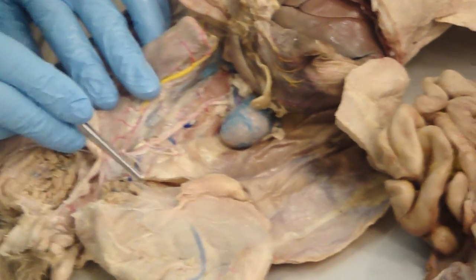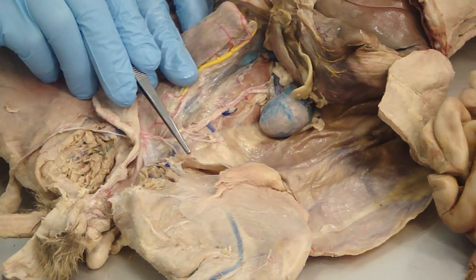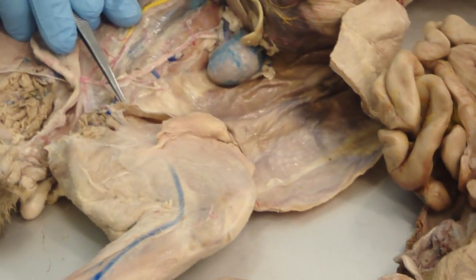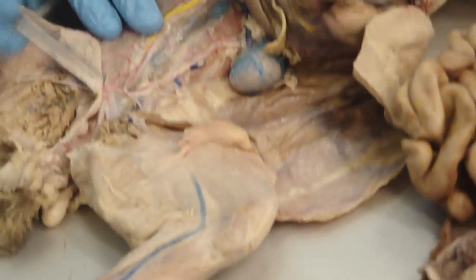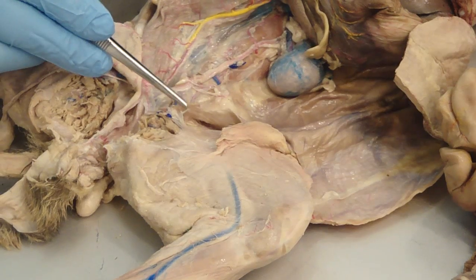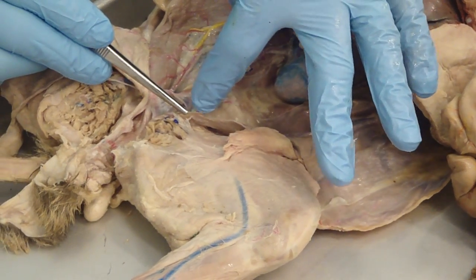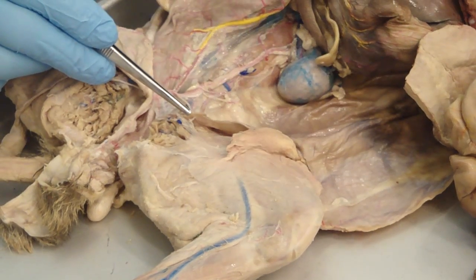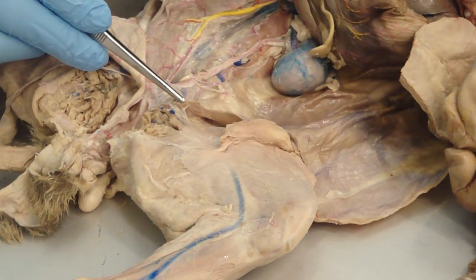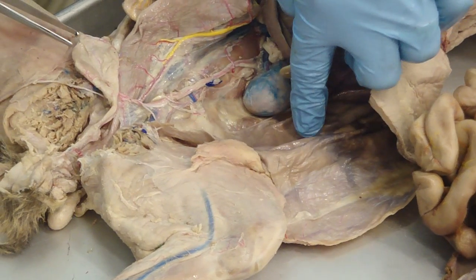The body wall, we've cut it open here, and you can see there's a weakening in the body wall right here. Right on the inside, there's a ring called the internal inguinal ring. On the outside is the external inguinal ring, and between them is the inguinal canal, where there are aponeuroses of the external oblique, the internal oblique, and the transversus. It's just a weakening.